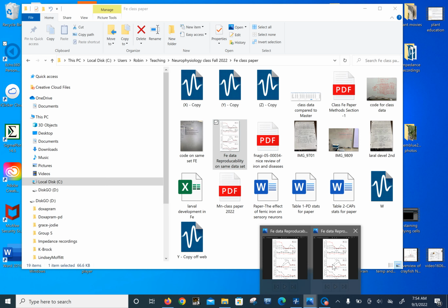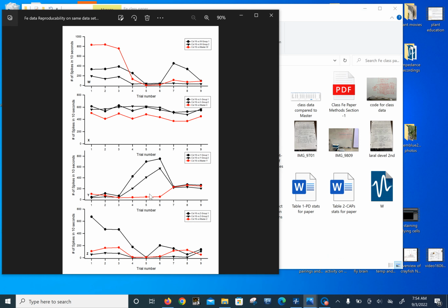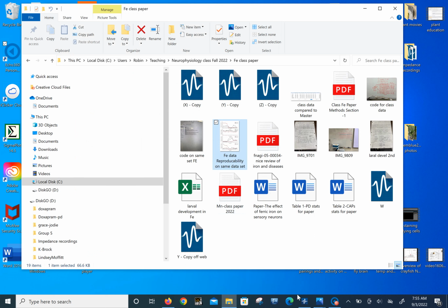We're trying to find out why the data sets are so different with this counting of the spikes. Let's just focus on Y right now, on this Y data set. We see that red was somebody that counted the spikes and watched by hand which spikes were being counted. And these are the two class data sets that we're looking at, the Y set. So why is there such deviation? Let's look at the file and go over that.